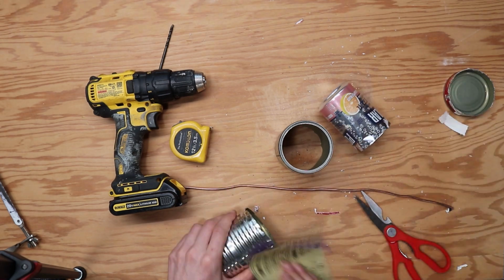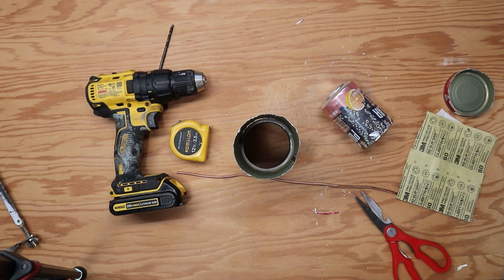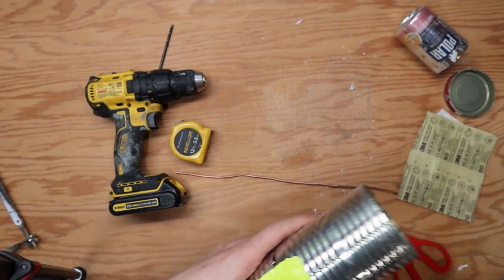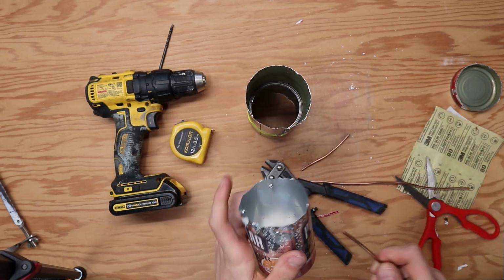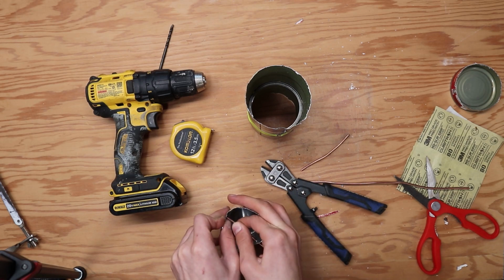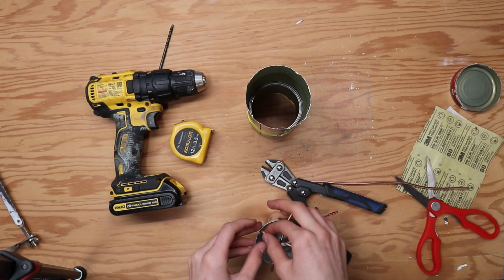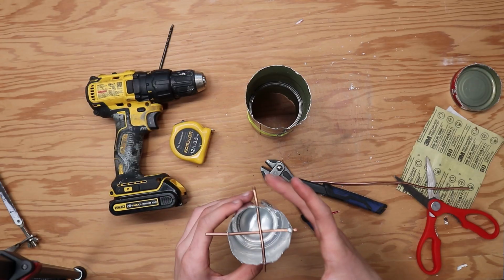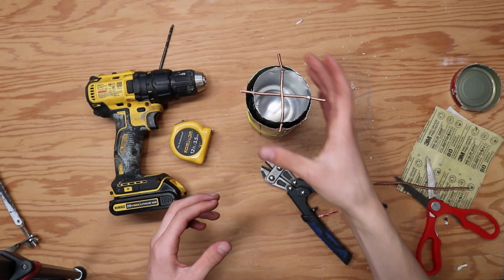Stack the 2 cans together and then tape them together with some heat-resistant tape. Duct tape works, but you might have to replace it after a couple uses of the calorimeter, as it tends to melt. Next, grab your stiff wire and a pair of wire cutters or scissors. Figure out how wide your widest cans are and add about 1/4 inch to that. Cut 2 lengths that are that size. You're going to stick the wire through opposite holes on the smaller can in an X pattern. Next, you can set the smaller can with the X wires in the top of the larger tube.